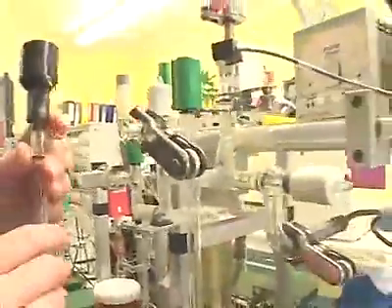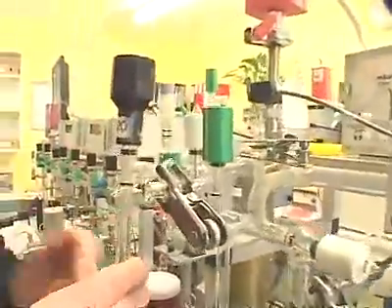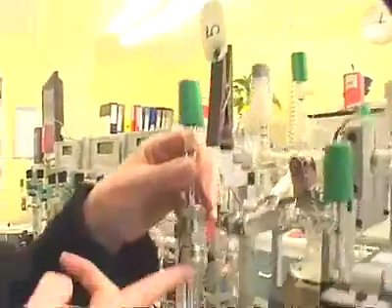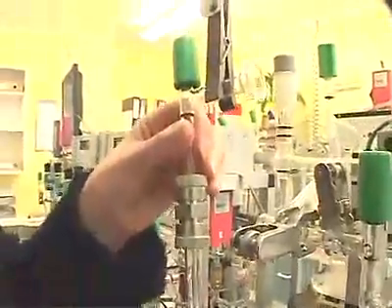The next step in the dating procedure is to take the carbon dioxide that we've collected out of the combustion tubes and make it into graphite. We go to this vacuum line, and the carbon dioxide is taken out of the mass spec bottle and put into a graphite reactor vessel where it's mixed with iron powder and hydrogen.